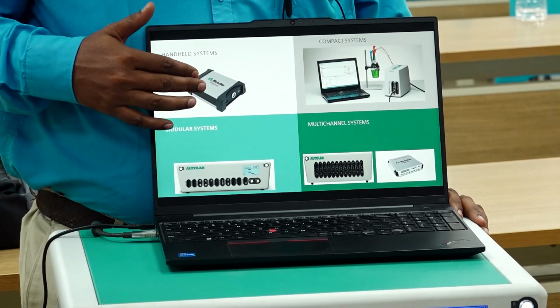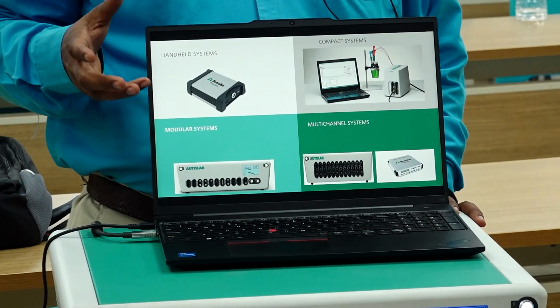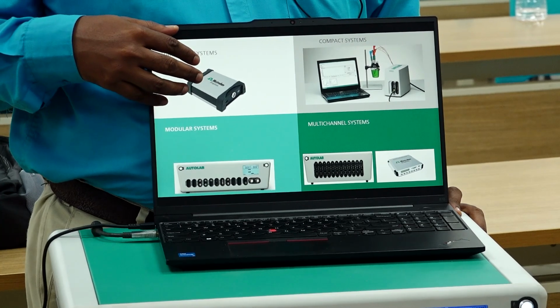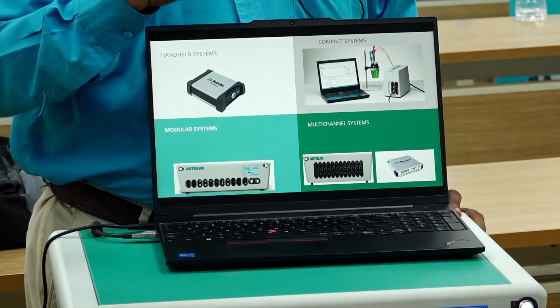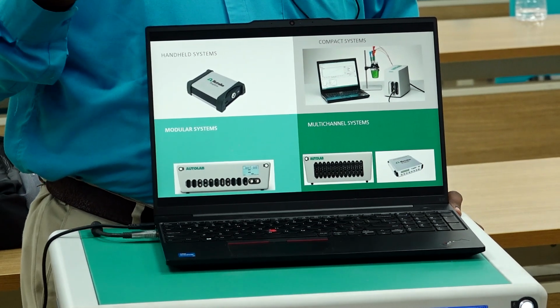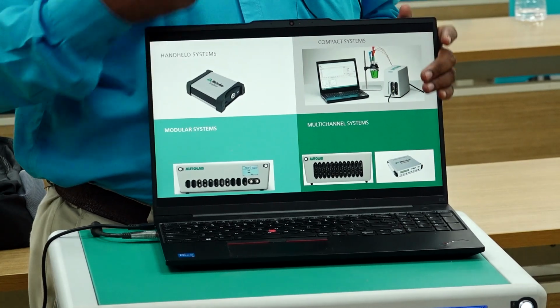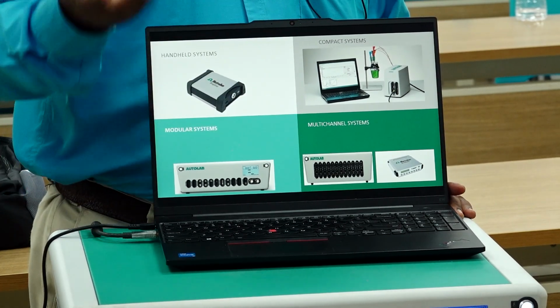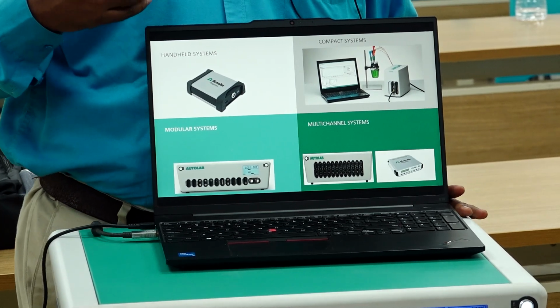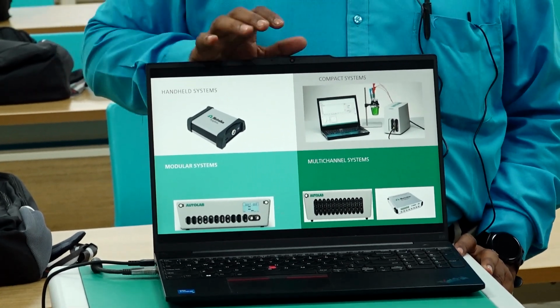In the case of these smaller equipments, the potential and currents are very minimal, plus or minus 4 volt, and it produces less than 100 milliamps of current only. By using this equipment, you can do normal corrosion experiments as well as biosensors. For those applications, you do not need a higher current. But if you are working on batteries or supercapacitors, then you may need a higher current. You may have to go for the next level of instrument where the current is higher. So, before choosing a proper instrument, you should know, for my application, what the basic requirements of my instrument should be.